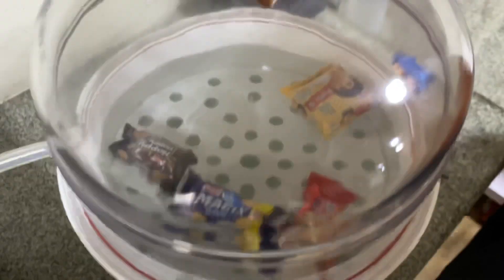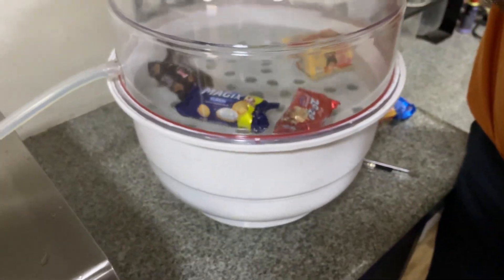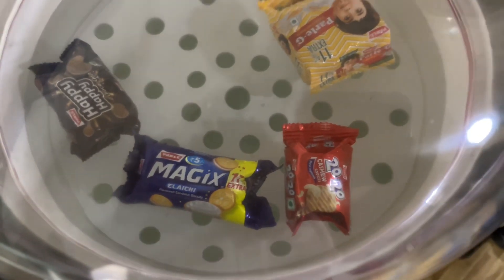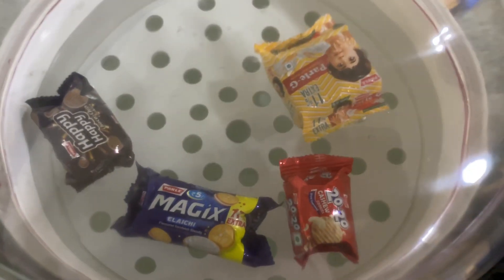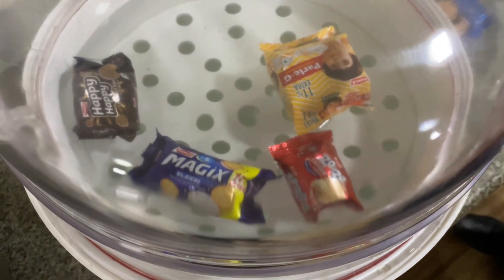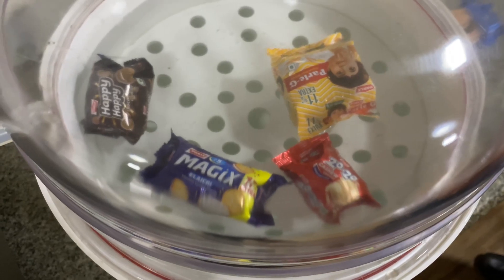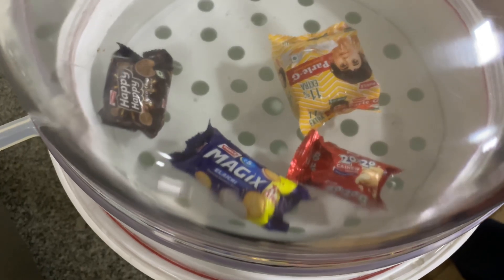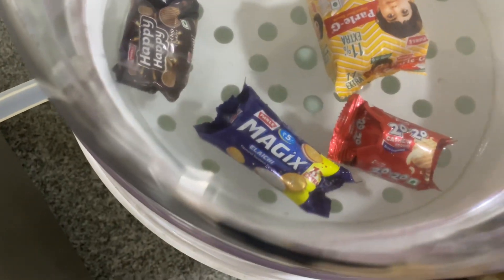As you can see, the vacuum is already created inside the desiccator. Please keep observing the red cashew packet and the Parle-G packet — they have been intentionally pinned so that we can understand the leakage. Immediately when the vacuum is released, there will be bubbles around these packets.